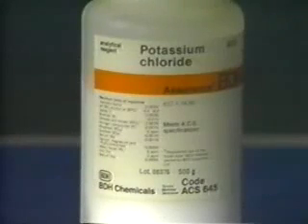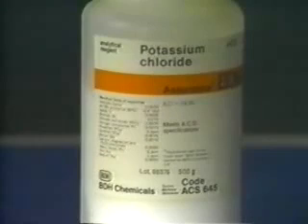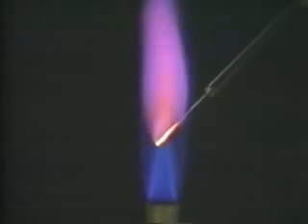Finally, potassium chloride. Potassium chloride on platinum wire is placed in the flame and it gives the characteristic lilac color.